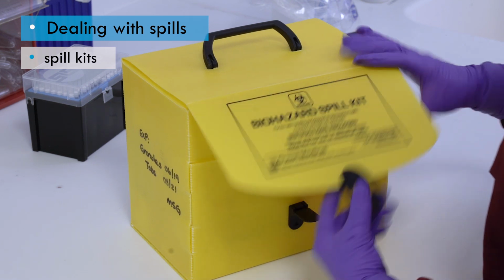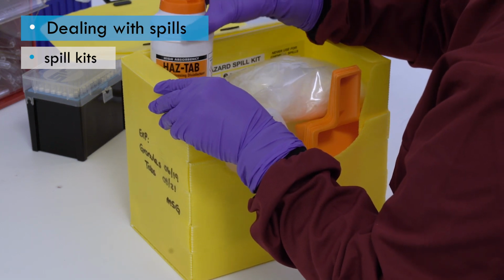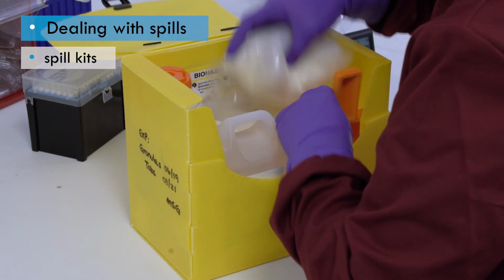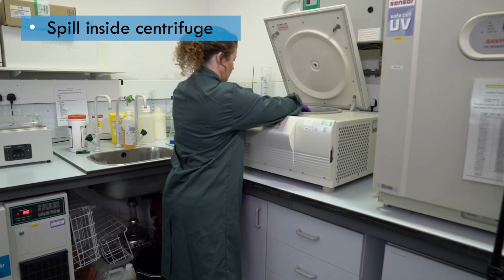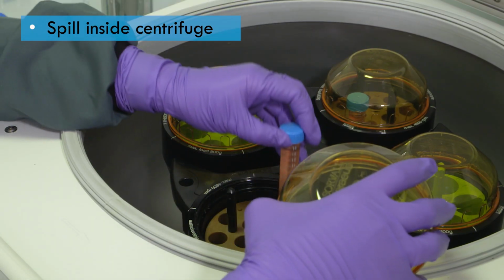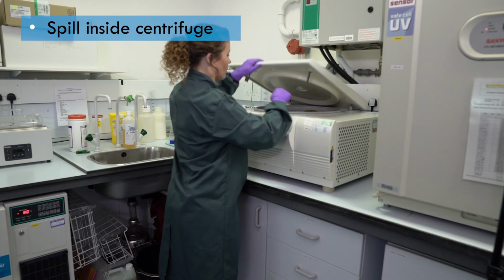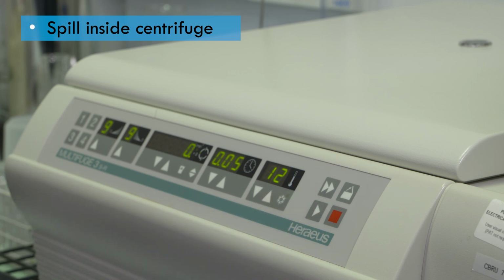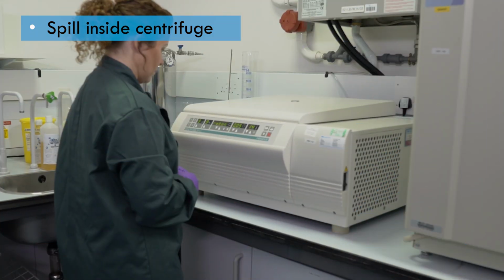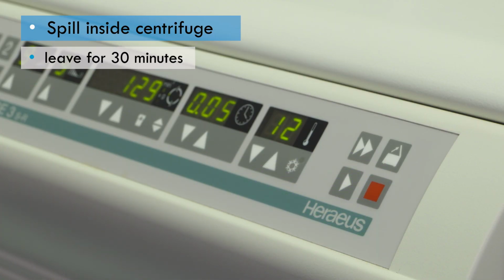Some laboratories are equipped with spill kits. These contain all the disinfectants and absorbent materials that are needed for dealing with a spill. On rare occasions, spills may occur within equipment. For example, a tube might break inside a centrifuge during a cycle. If this happens, you should follow manufacturer's instructions, but the general procedure would be: stop the machine immediately and leave it for at least 30 minutes to allow any aerosols inside the machine to settle.